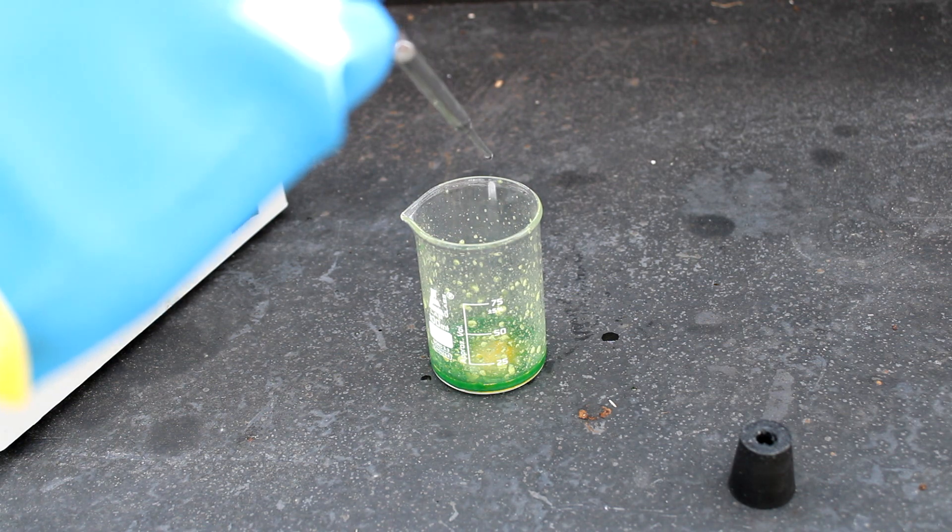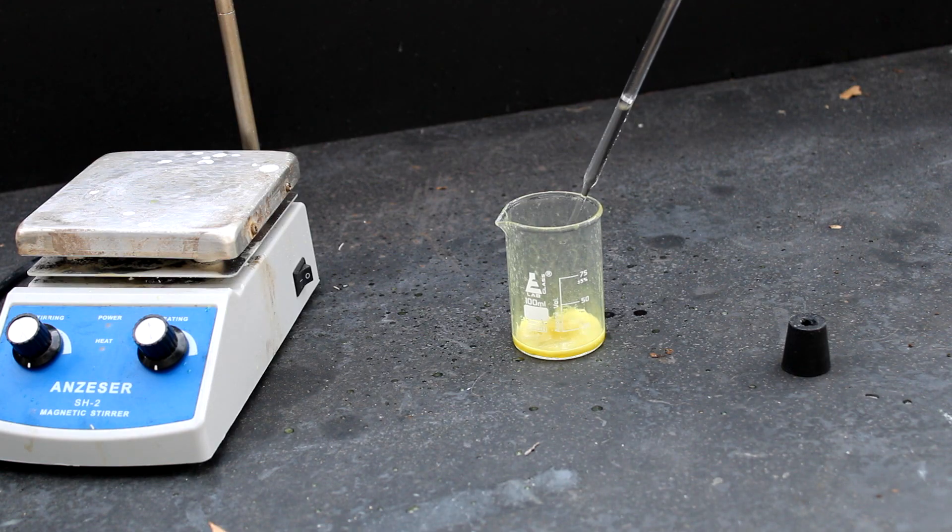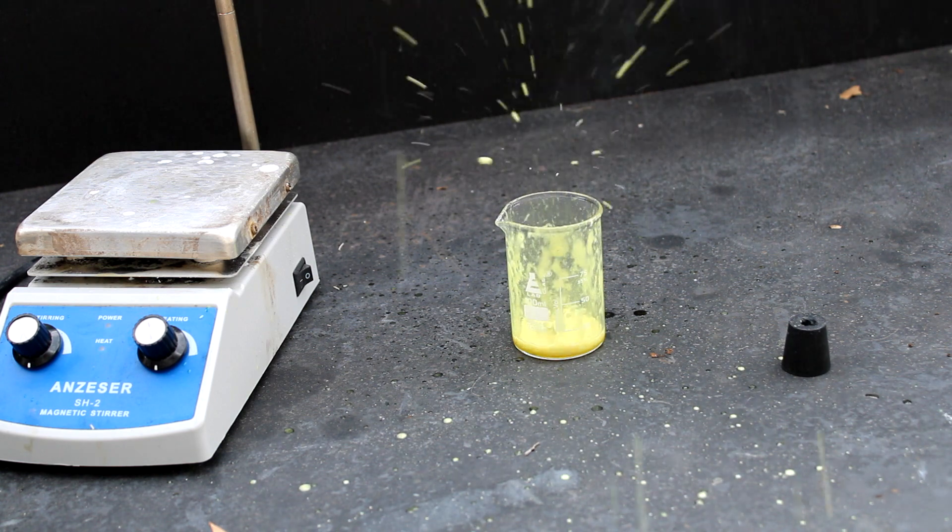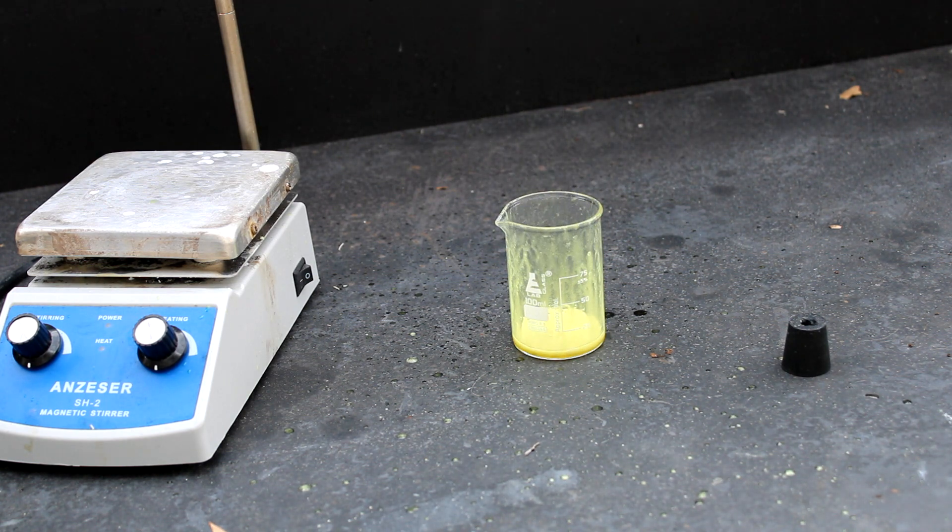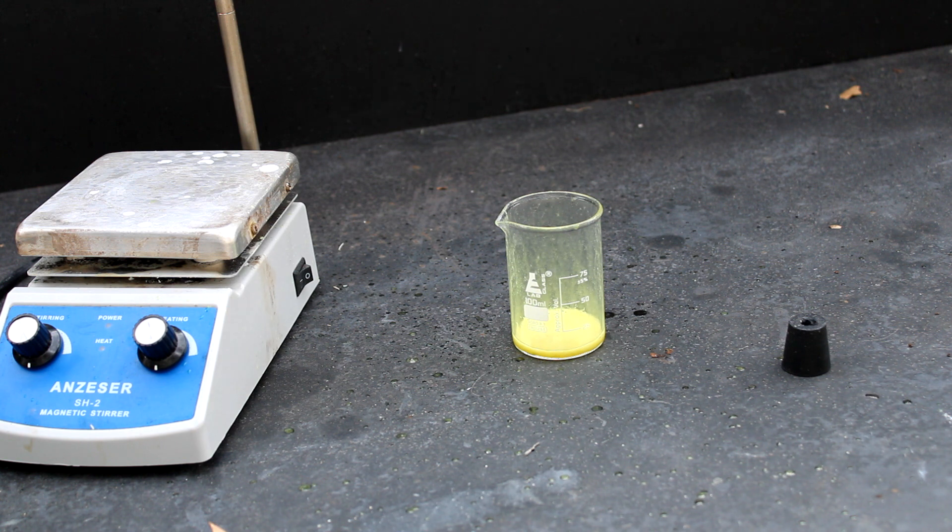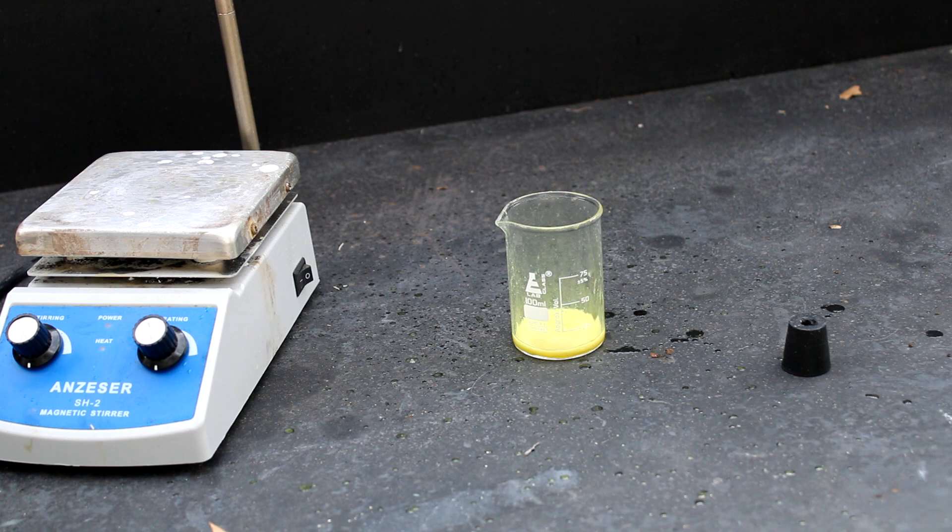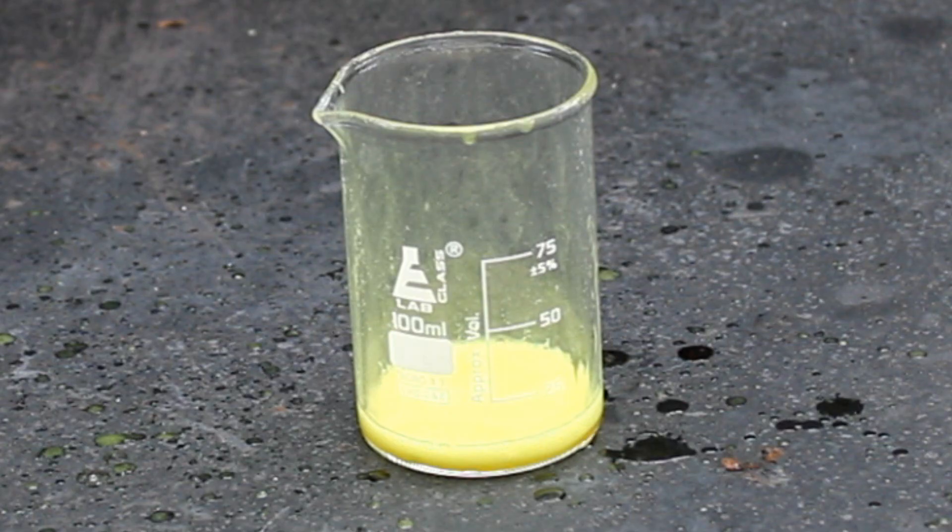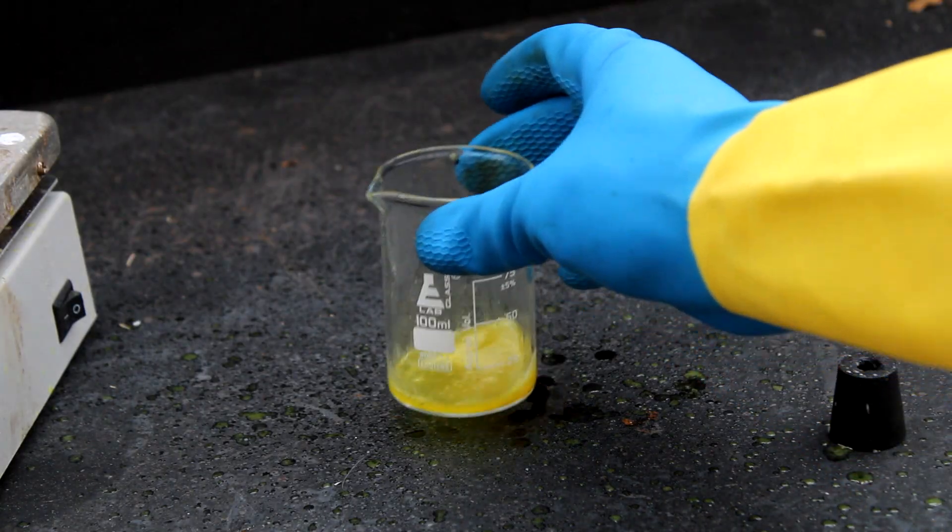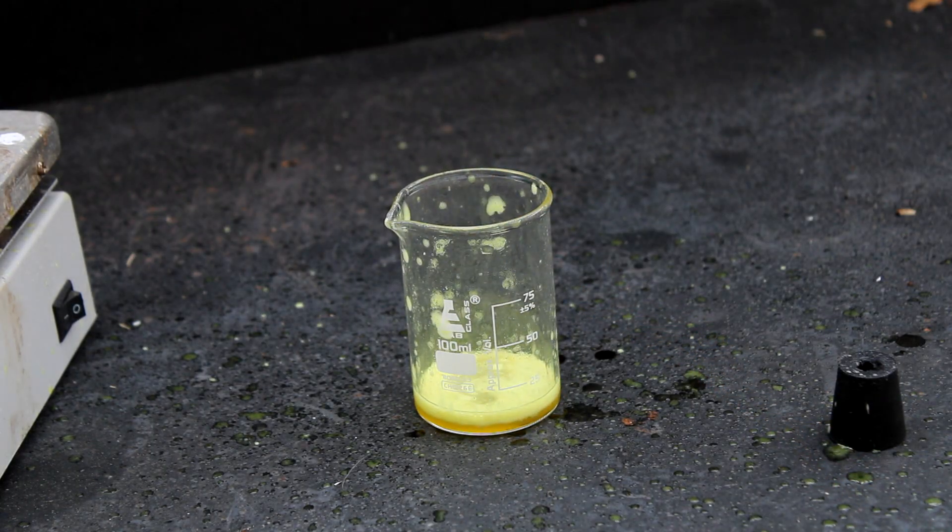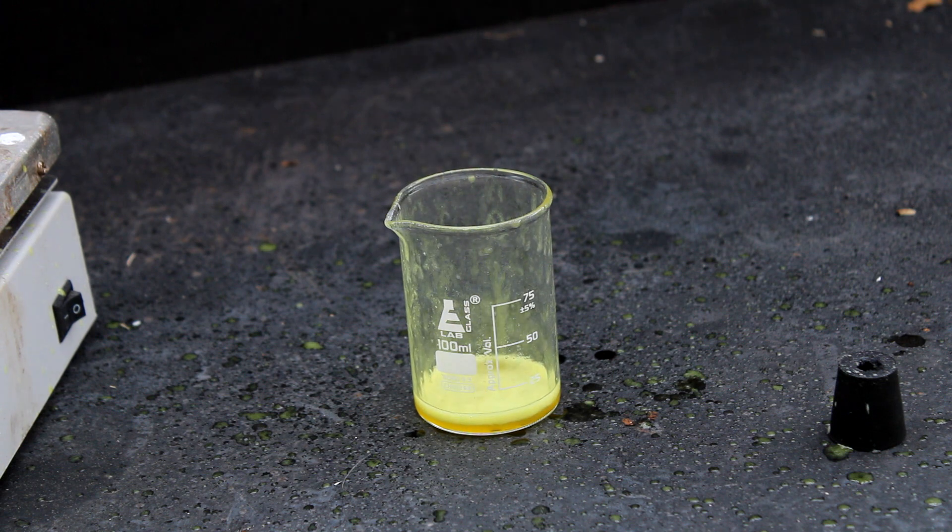This is pretty bad. So yeah, it seems like the more concentrated chloric acid is destroying the dyes in solution much more violently, and with a whole lot more chlorine dioxide formation. Look at all that yellow. Now do you understand what I mean by unhandleable?